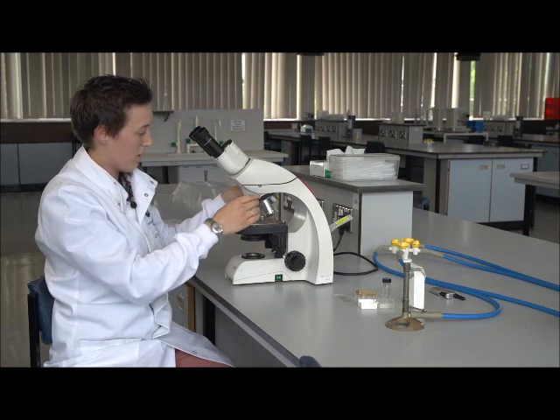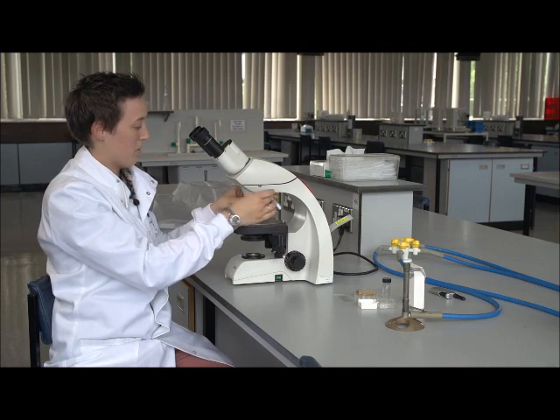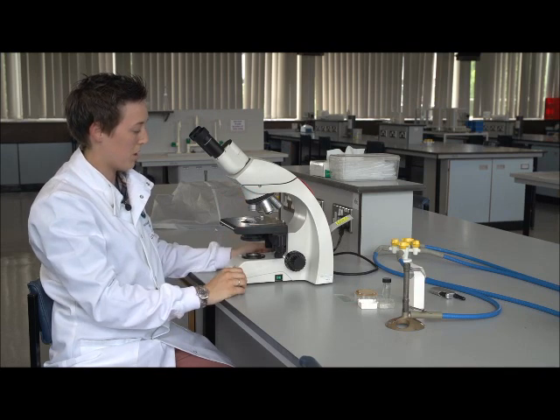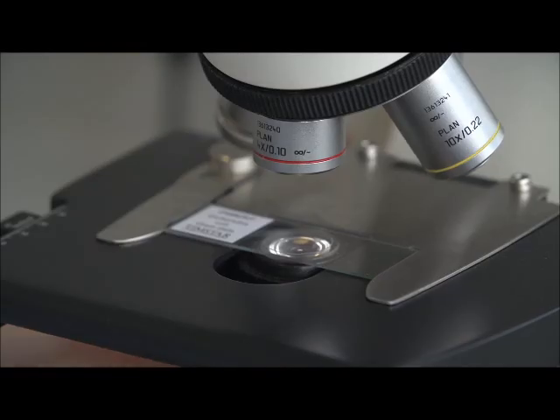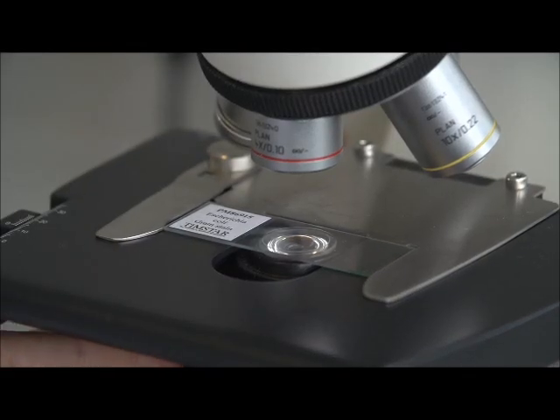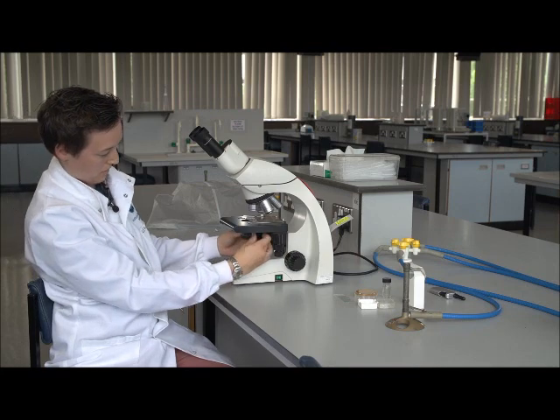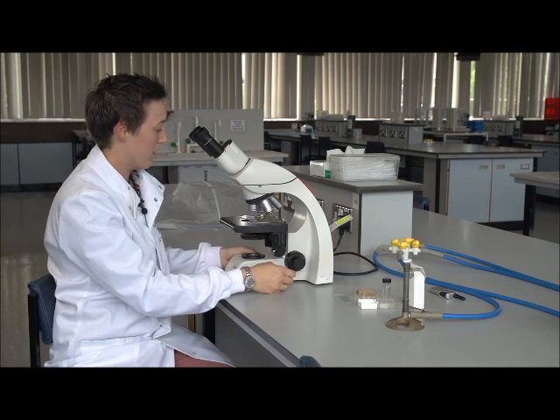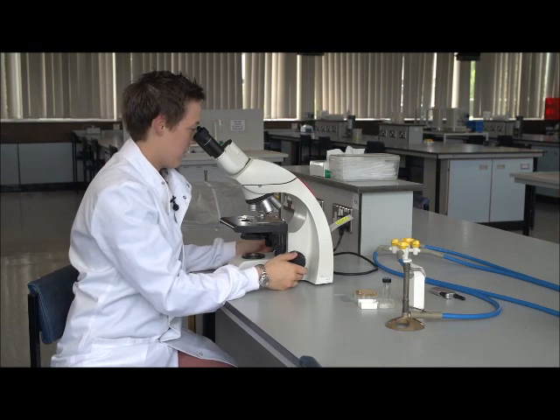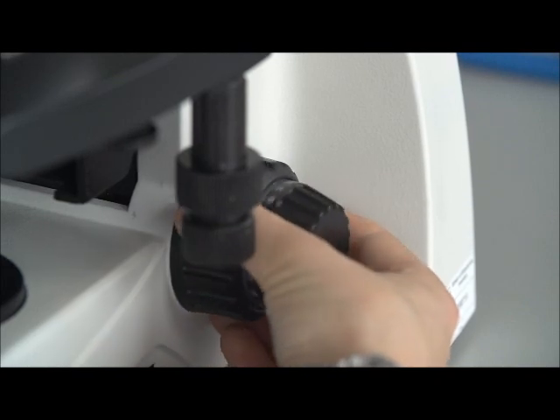Now this particular slide, we will start again. We'll start at 4 times again, bring our stage back up to the top, bring our aperture back down, take our phase ring back out, and probably turn the light down a little bit more. And we'll find ourselves at 4 times first.